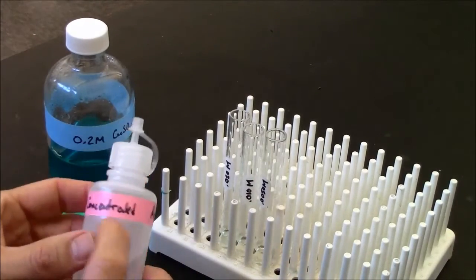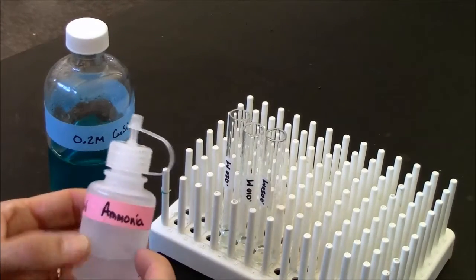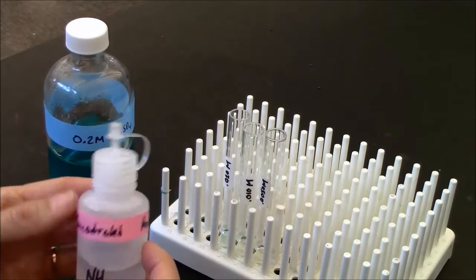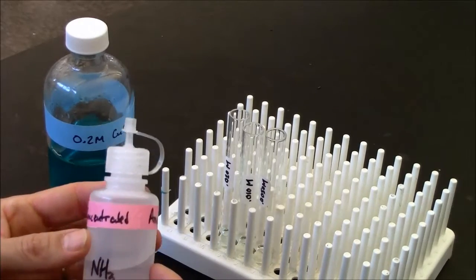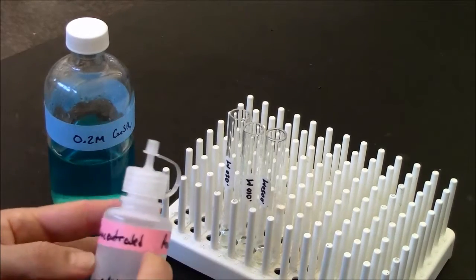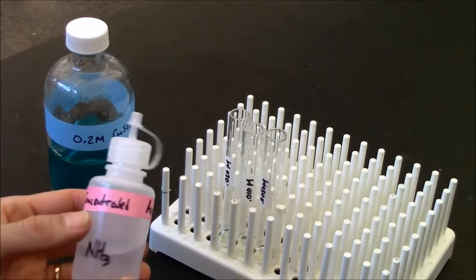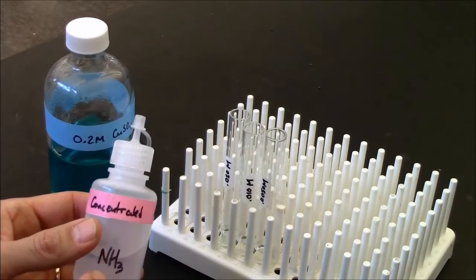I have here some concentrated ammonia. It's aqueous, and it has a pungent odor which you may recognize. Ammonia is commonly used in cleaning products, like Windex has ammonia in it, and the chemical formula is NH3.